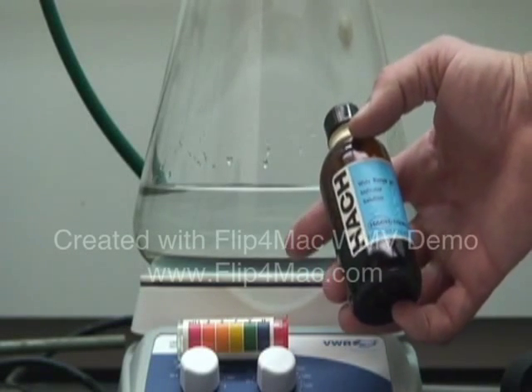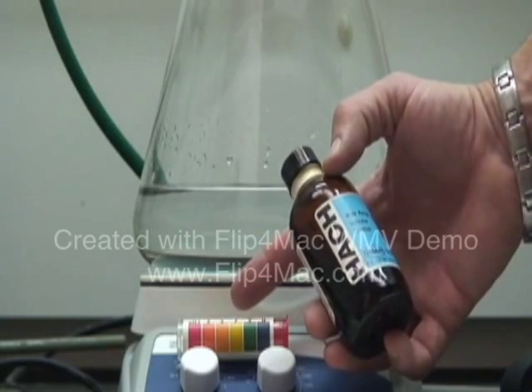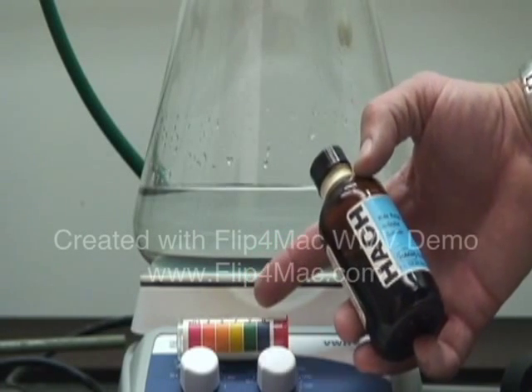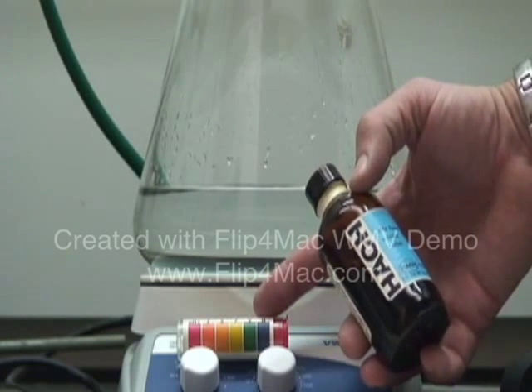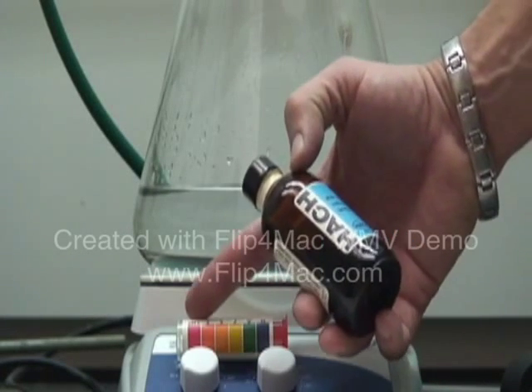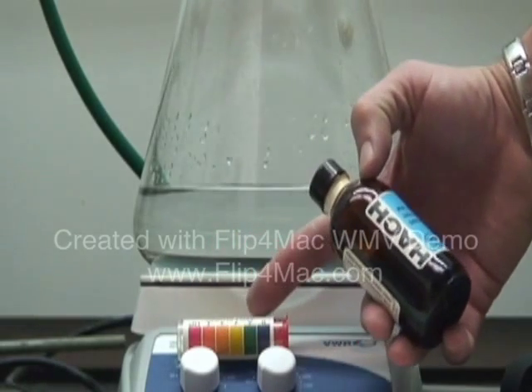This indicator solution changes from yellow at a pH of seven, all the way up to a blue-purplish color at a pH of 11, and all the way down to red for a pH near one.